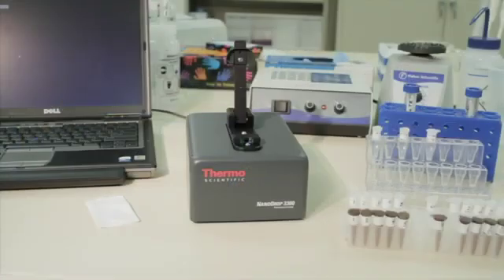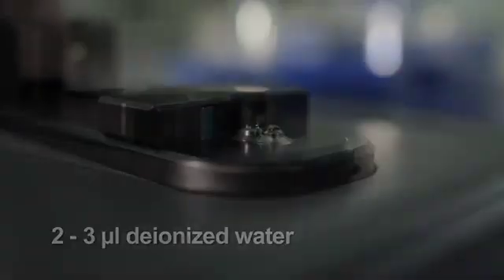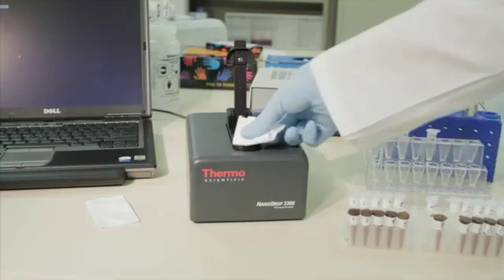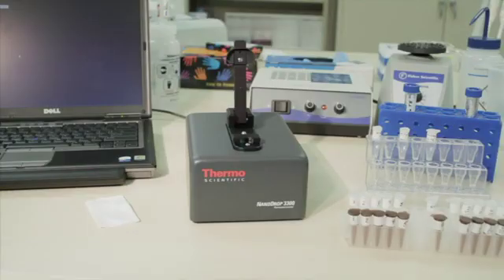To prepare the instrument and perform measurements, first clean the lower and upper surfaces of the sample retention system. Pipette 2 to 3 microliters of deionized water onto the lower optical surface. Close, then open the lever arm and blot the upper and lower pedestals with a clean, lint-free laboratory wipe. Ensure the surfaces are free of lint before proceeding, as lint can exhibit fluorescence in the presence of an excitation source and can interfere with the measurement.